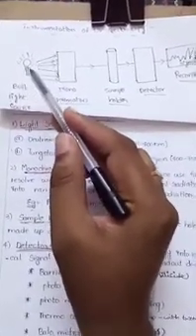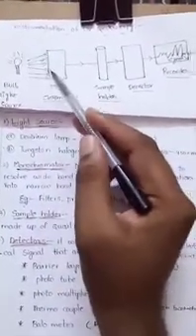In instrumentation of UV spectroscopy, we have different components. The first is the light source, which produces light rays — types of electromagnetic radiation. Next is the monochromator, then the sample holder, which we fill with the sample, that is the analyte substance. From the sample holder, the signal passes to the detector chamber, then to the recorder. The detector detects the signal, and that signal is displayed in the recorder. These are the various parts in instrumentation of UV spectroscopy.